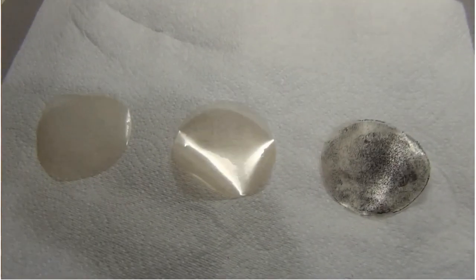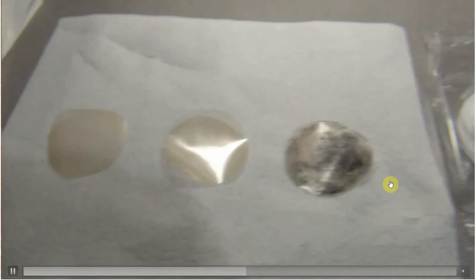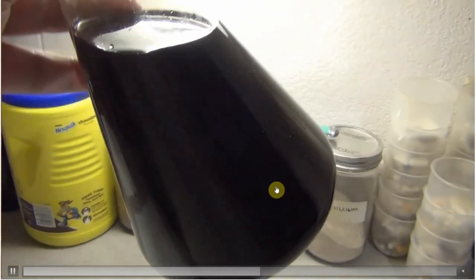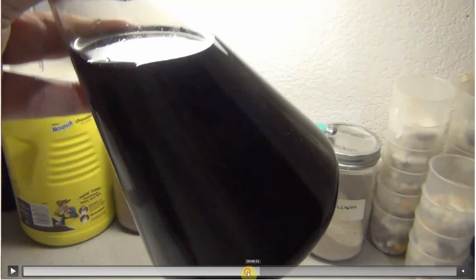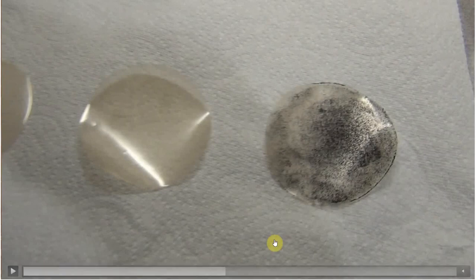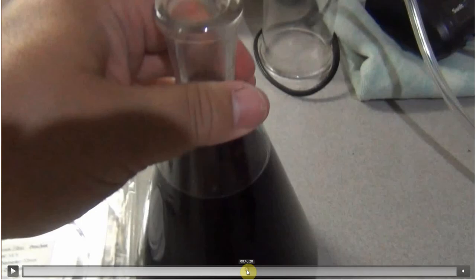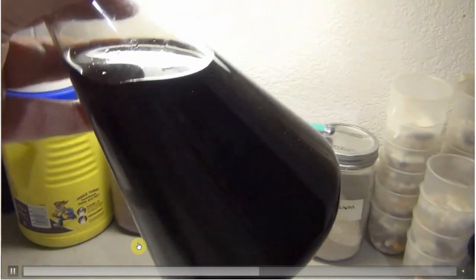The cool thing is — just 24 hours at heat — these are what the filters look like. I did 350 milliliters per filter. The first two came out clear, the last one has sediment from the bottom. This is the finished product — it's perfect, it's beautiful. Looking at the residual remaining, I put in 0.8 grams and I'd say I probably saturated a good 90% of it. So at least 90% saturation of 0.8 grams — do the math. That was batch number two using heat.